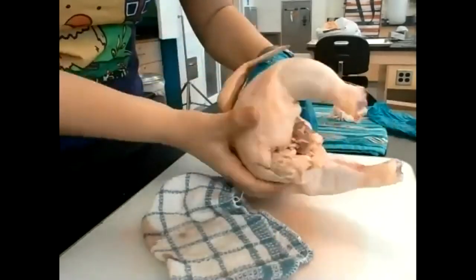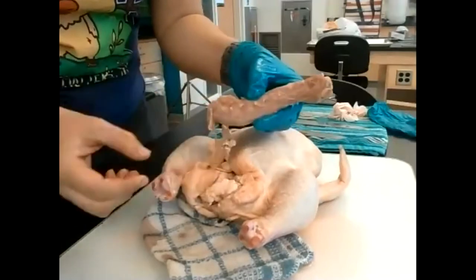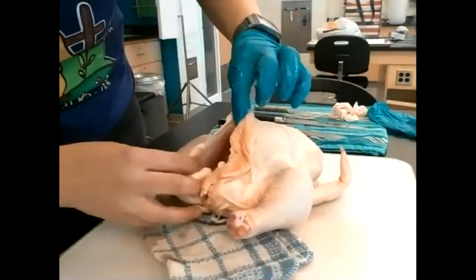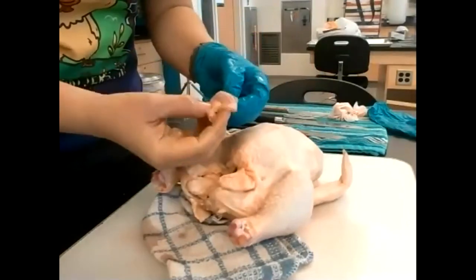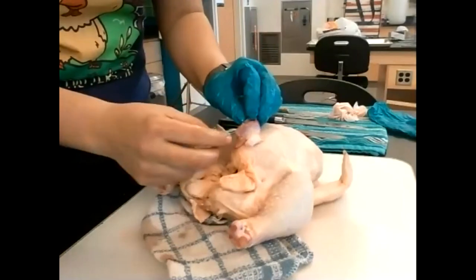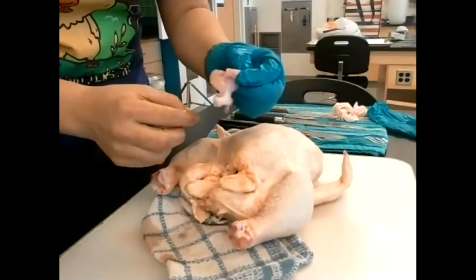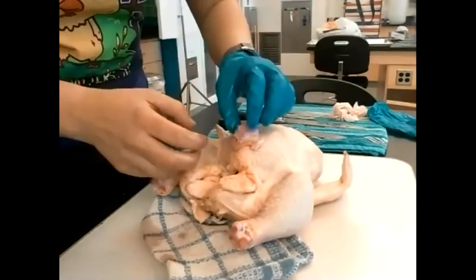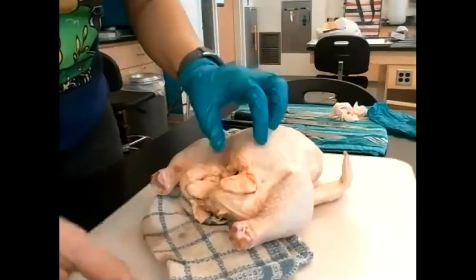If you get a full broiler bird, there might be some goodies inside — this is the neck. Inside here is part of the gizzard. Chickens don't have teeth, so they eat things whole, and in their stomach they grind the food together — that's how they chew, not with their mouths.